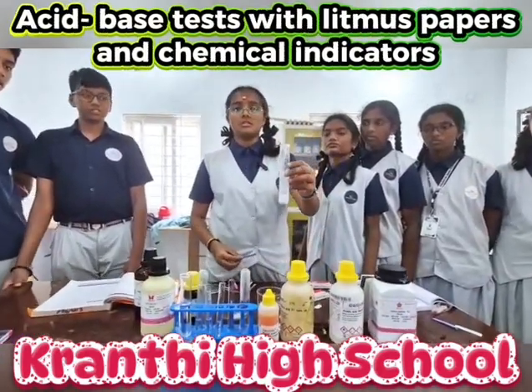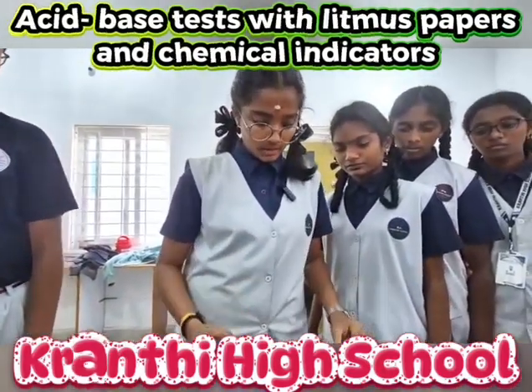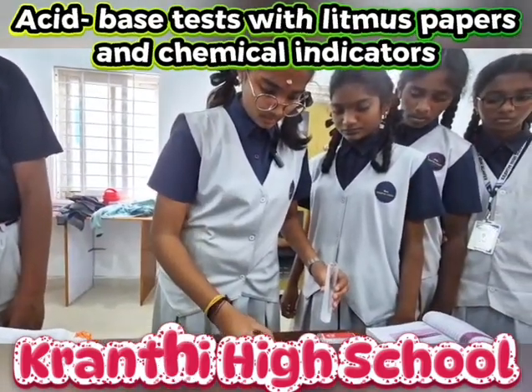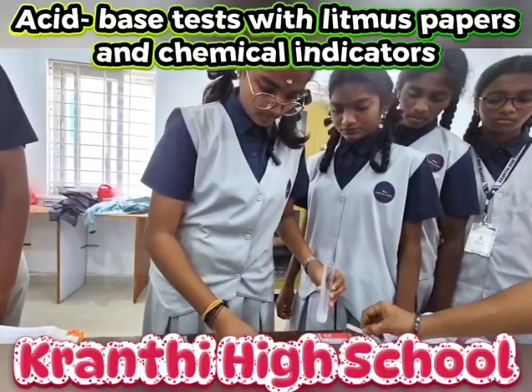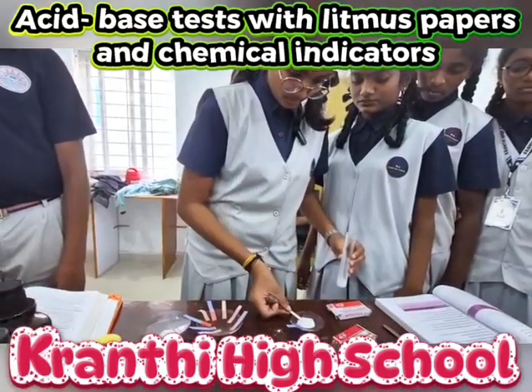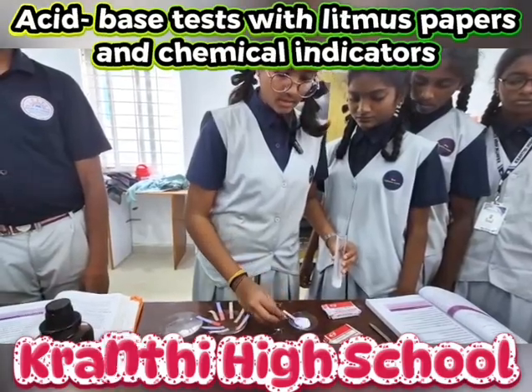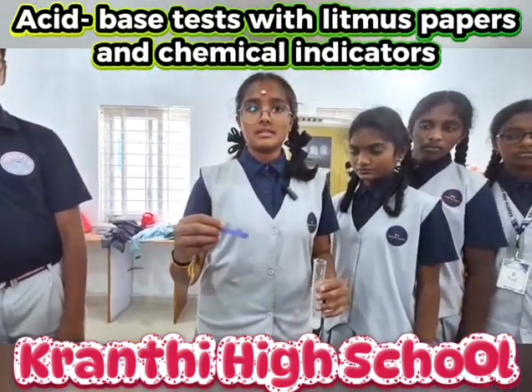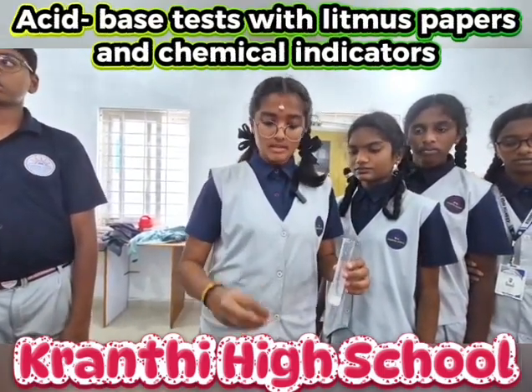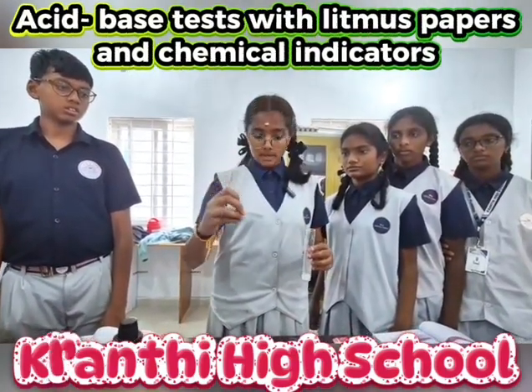This is the diluted solution of calcium hydroxide. We will dip the blue litmus paper into it. As you see, the blue litmus paper did not change its color because the calcium hydroxide is a base, and the red litmus paper had changed its color because it is a base.